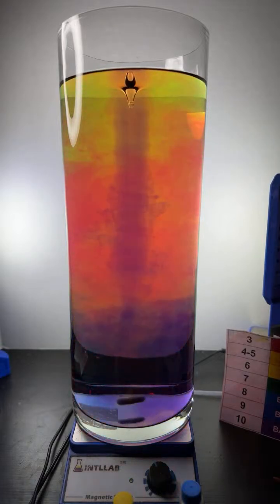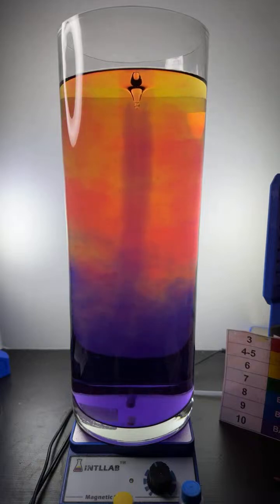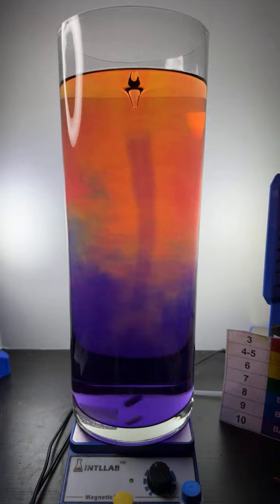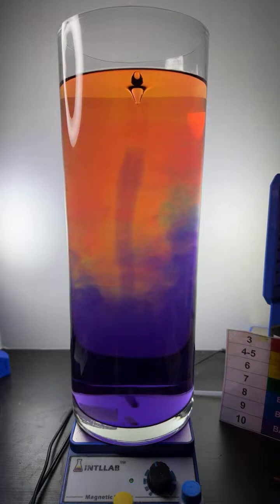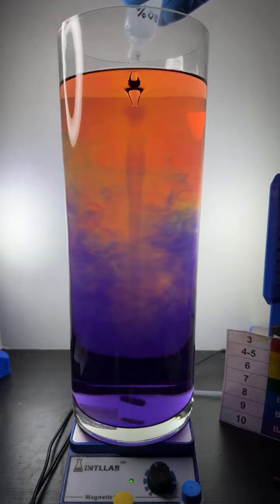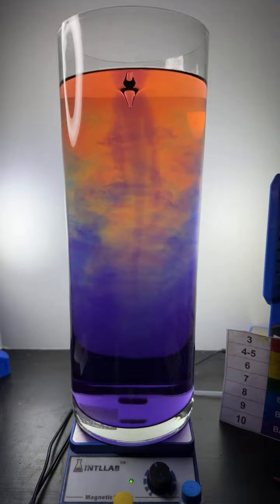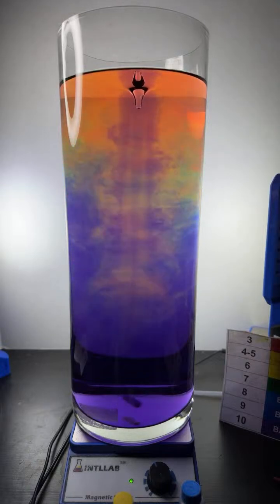Yeah, if we get enough folks in the live, I'm going to do a secondary experiment today, the color separation experiment. That's kind of fun, if you've seen that before. Right now, all I'm doing is adding acid or base. Right now I'm adding base, sodium hydroxide base, to a 1.5 gallon container that contains universal indicator.